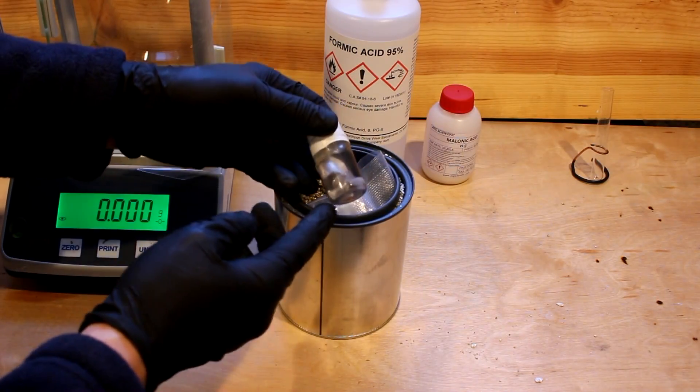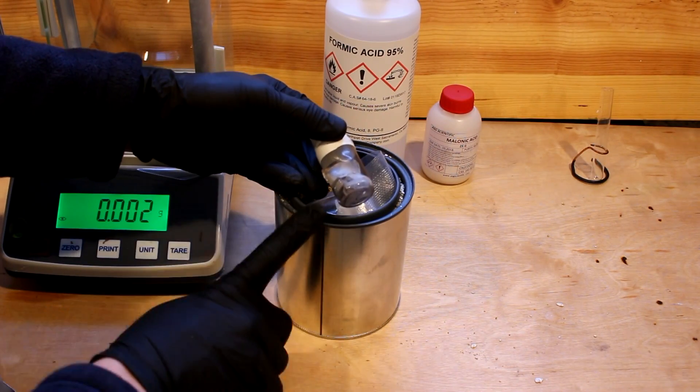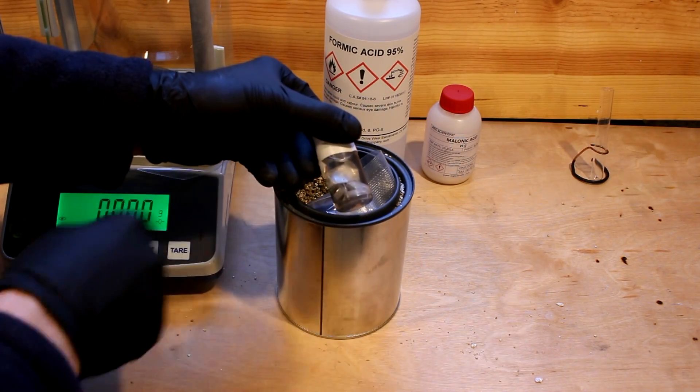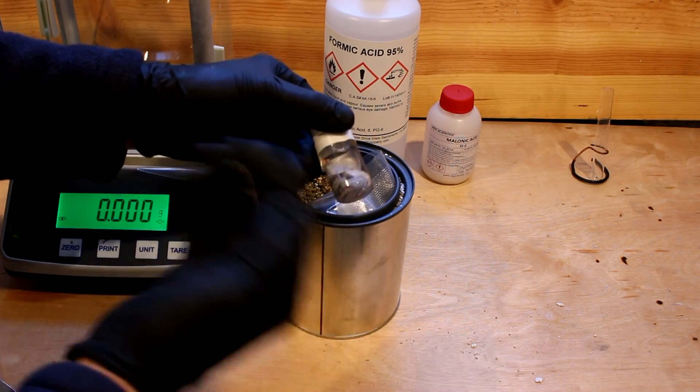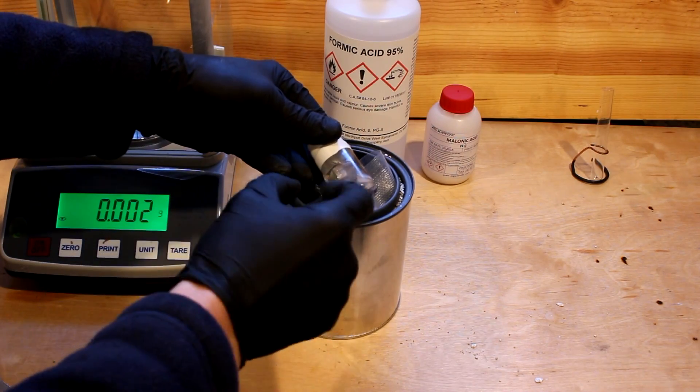The lethal dose of thallium is about the same as the lethal dose of mercury. But thallium, I would say, is more toxic than mercury because this stuff is a known carcinogen, whereas mercury is not. So anyway, let's get one of these chunks out of there and see if we can make a super heavy liquid.